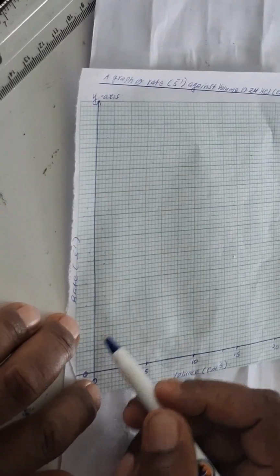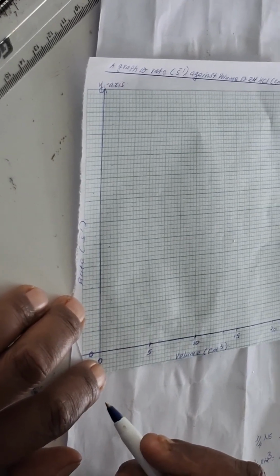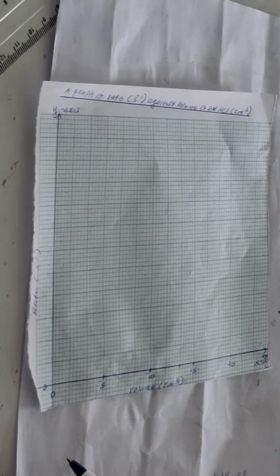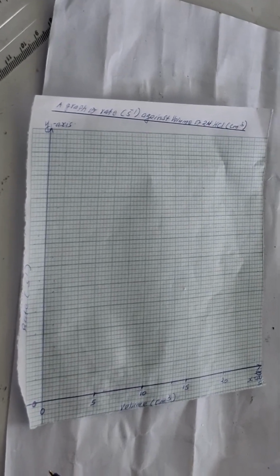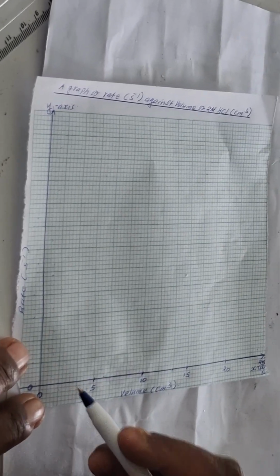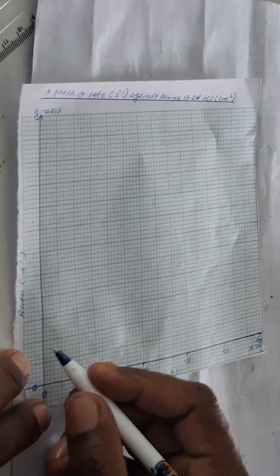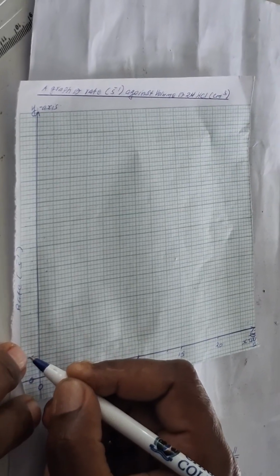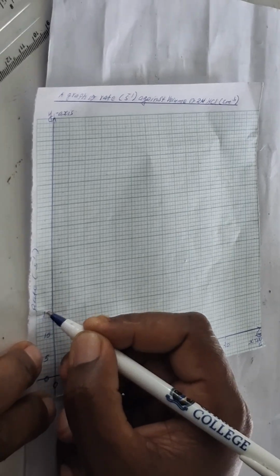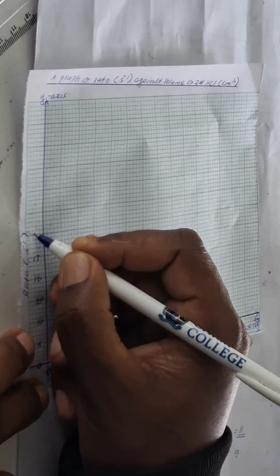Let's say two boxes to be 15. That will still be smaller, because if two boxes were 10 and still it was small, then it means we have got to add. But let us take just the one for 5, we just use it to see what is going to happen. So we'll have here 0, and then 5, and then 10, and then 15.